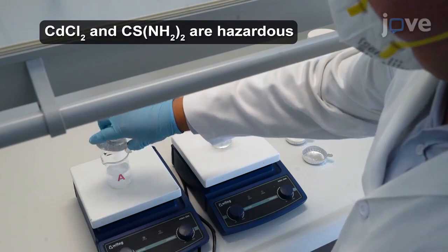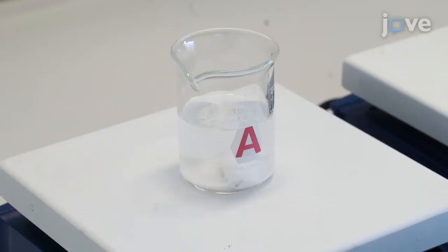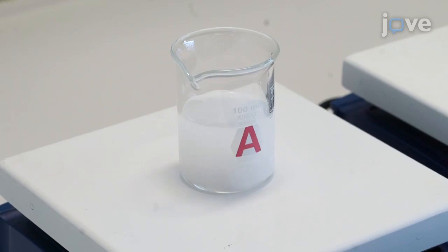Following this, place beaker A on a stirring hotplate and heat to 334 kelvin with moderate stirring speed for two hours.